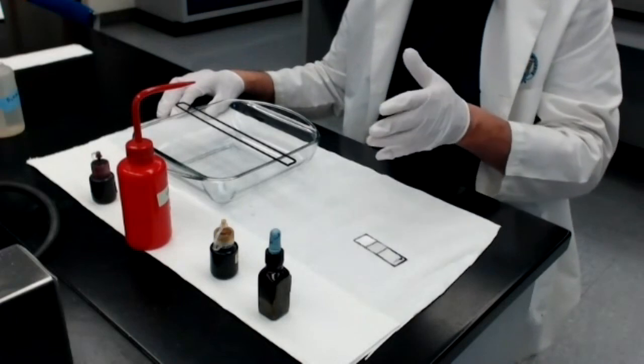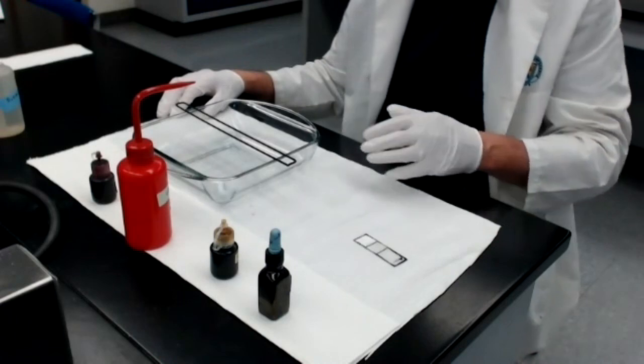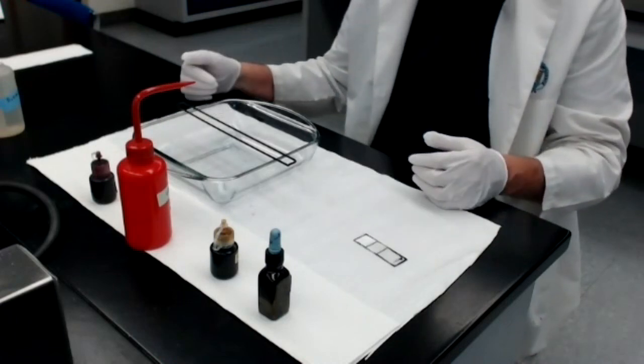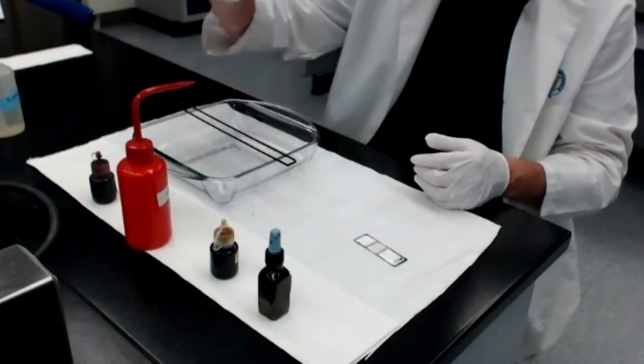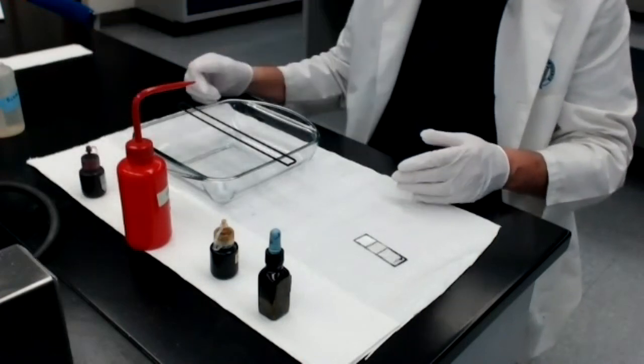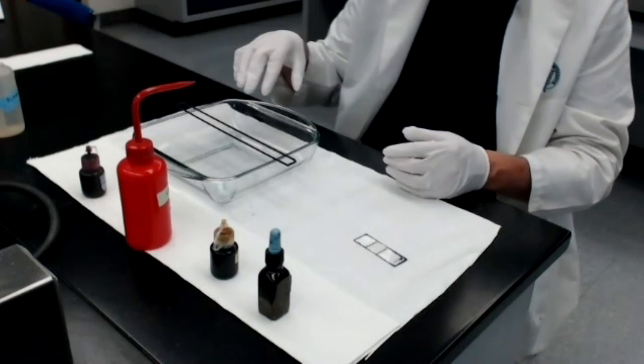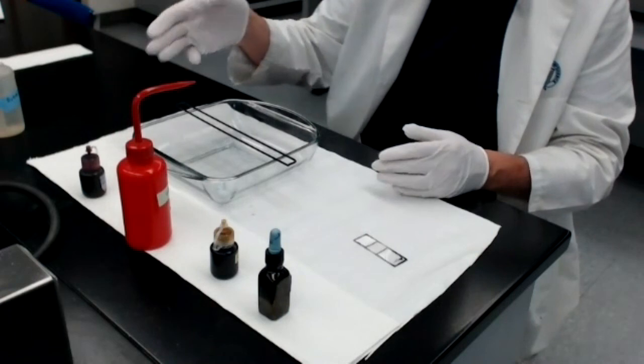The acetone is arguably the most important part of the step here because it is used for decolorization. What you want to do is remove the crystal violet from all the bacteria that are not gram positive. And that's done by the decolorizing agent. And then you come back with the counterstain safranin, and all those bacteria, if there were any that were decolorized, you want to recolorize them, pink or red, using the safranin.